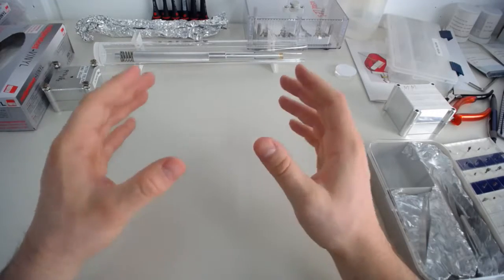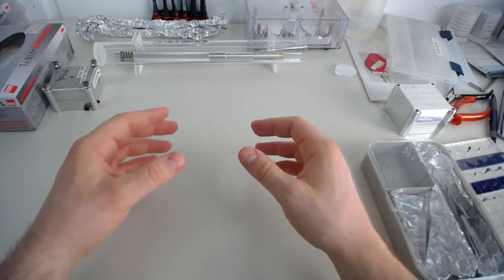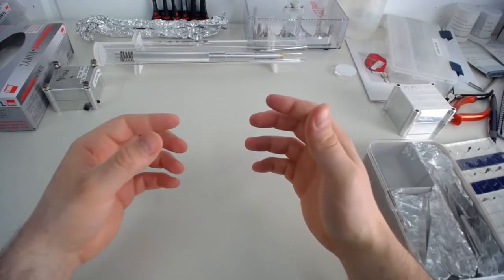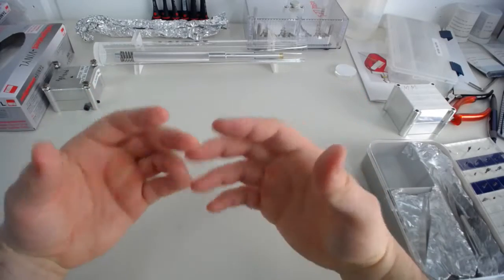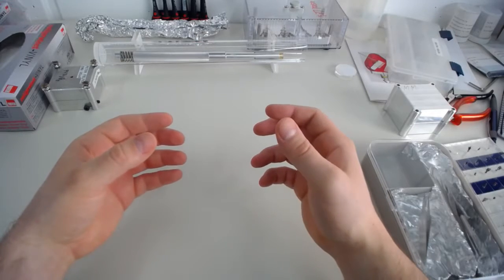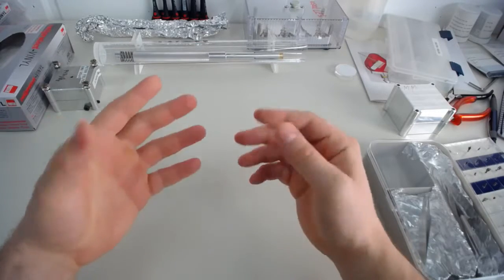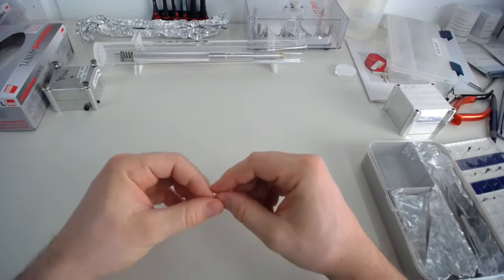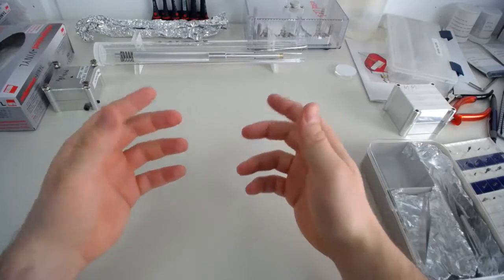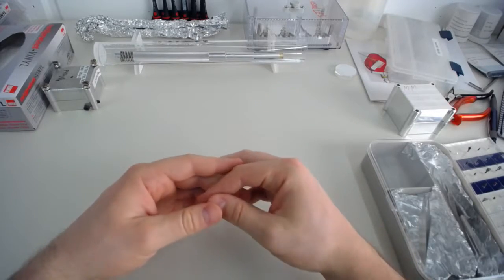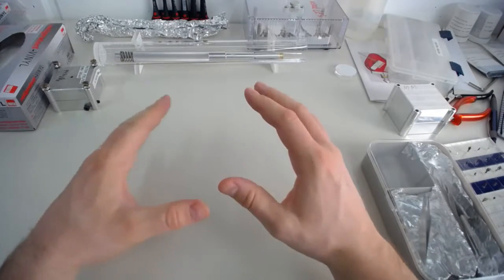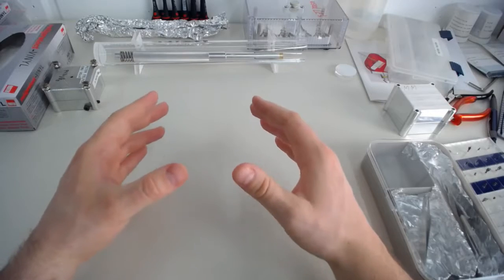I've seen in a lot of labs that people have unresolved issues with specimen failures, and I think very often that's actually because they don't keep themselves grounded very well. Anyway, the second really important bit is that we need to work clean, and what that means is our entire work area needs to be free of dust, free of dirt, and free of grease most of all. So one of the big problems is moisture and grease from your fingers, and that is something we need to keep away from our samples at all costs.